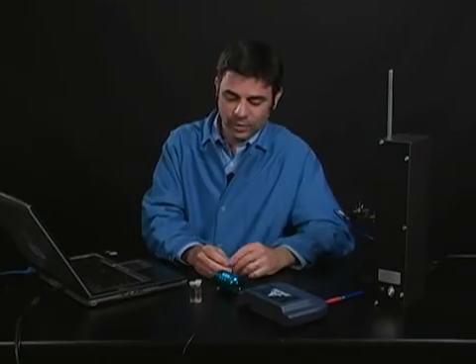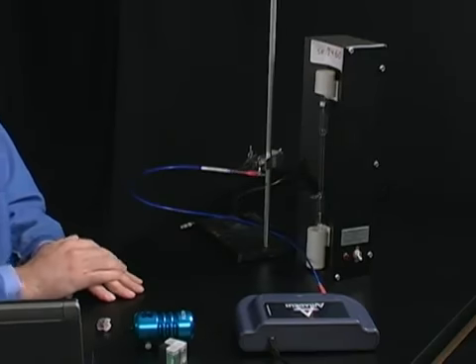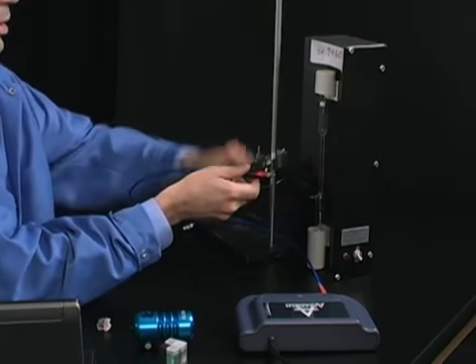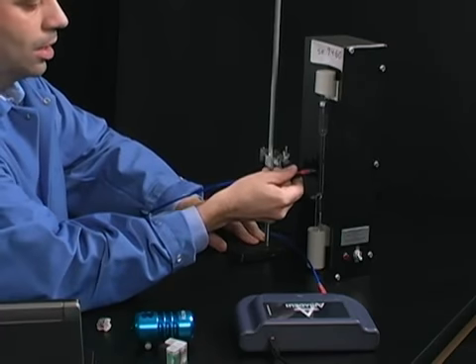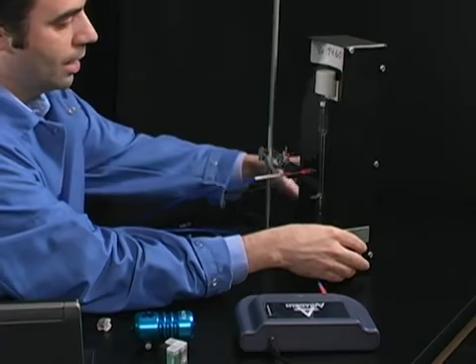So now we can look at a sample you would look at in a chemistry class. I have helium in here, and I'm going to line this up. This is where the ring stand and the clamp are very useful. I can get those to line up. I don't have to try to hold it steady or anything.